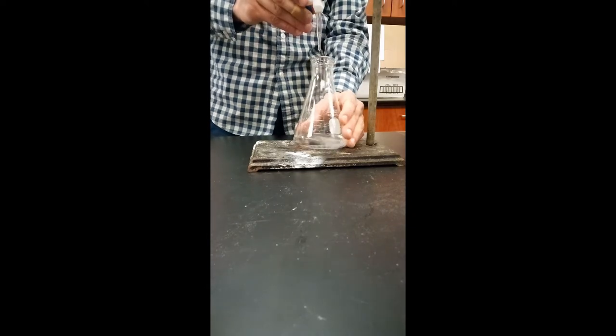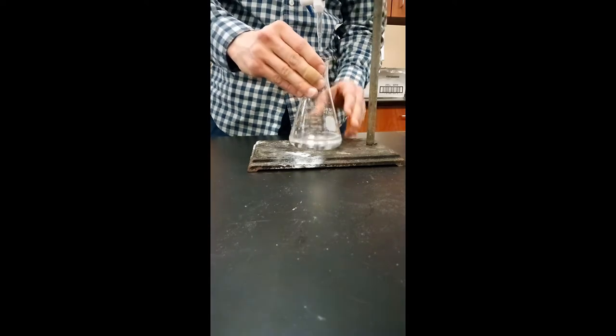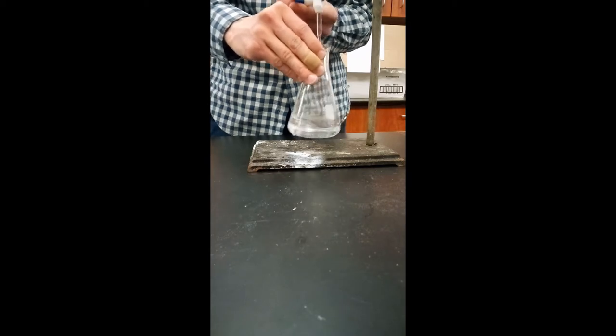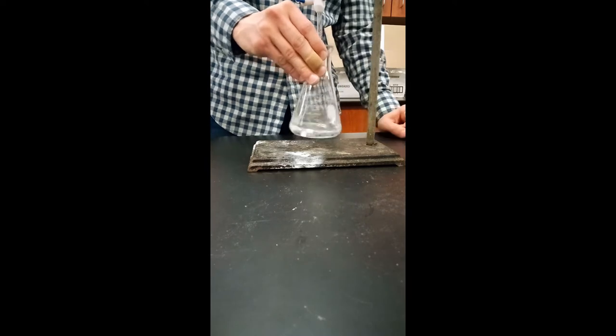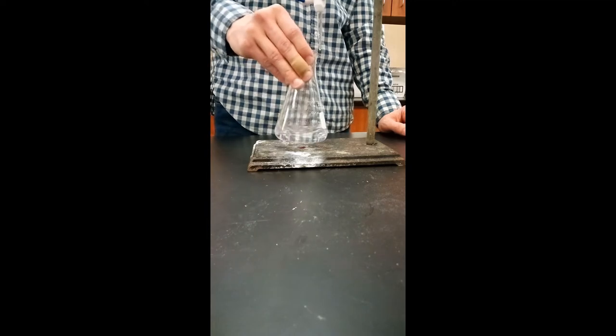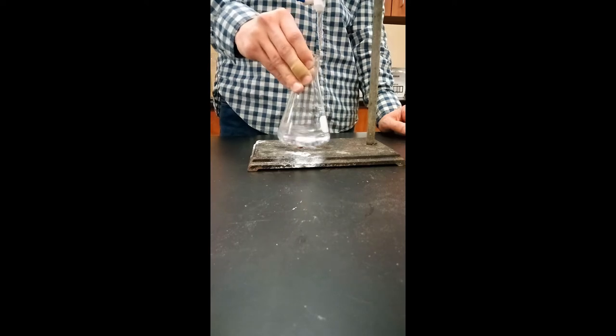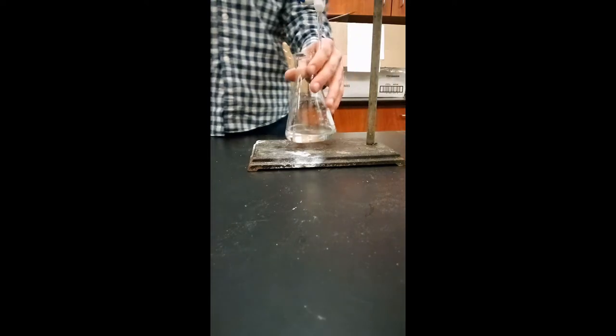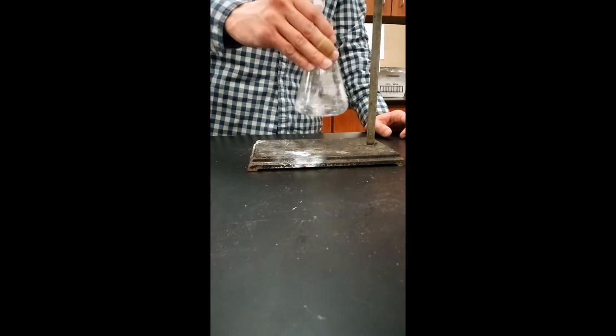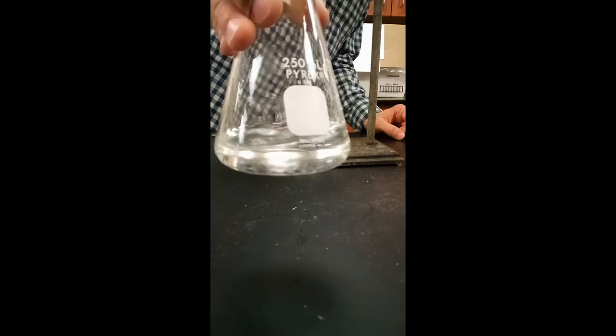You want to go little bits at a time so as to not go too far. Okay, so after the first bit of sodium hydroxide added, there is not a clear pink or faint light pink color yet persisting in our flask. So we'll add a little bit more.